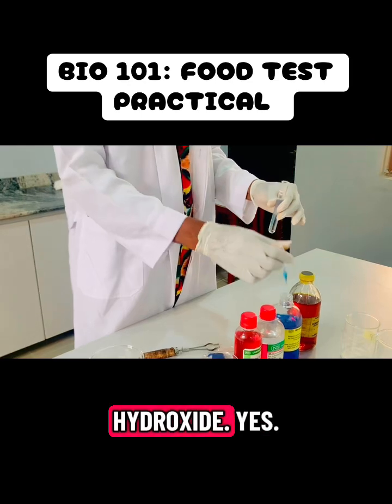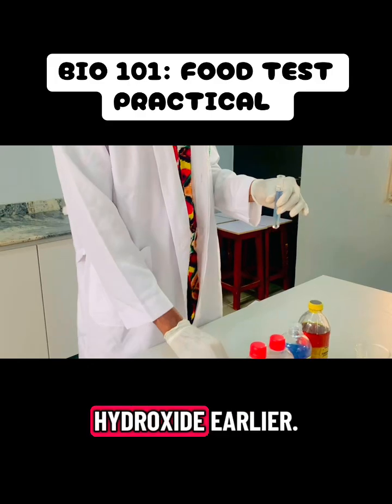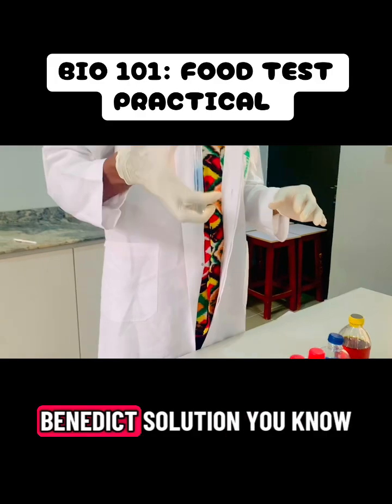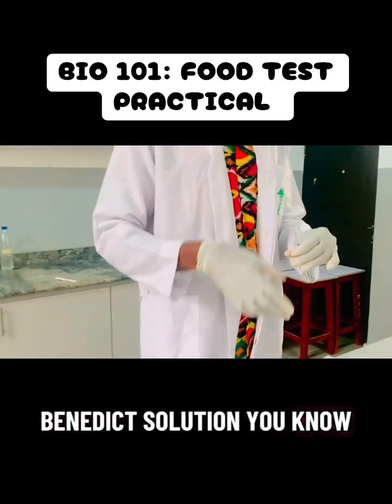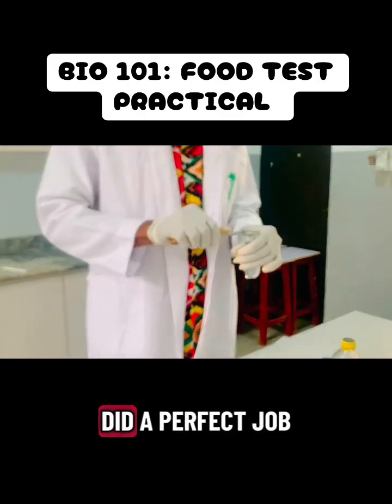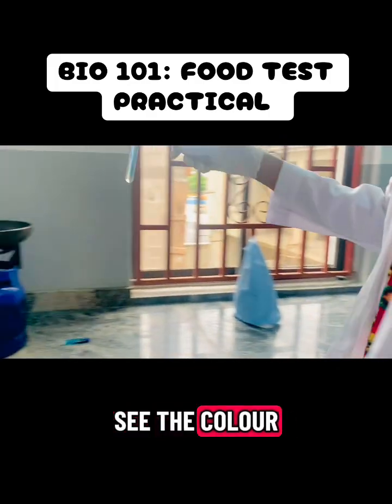So my sodium hydroxide. Yes. So I've added my sodium hydroxide earlier. Sorry for that mistake. And then this is my Benedict solution. So this is actually my first time recording, so I hope I did a perfect job. So you can see the color here already.